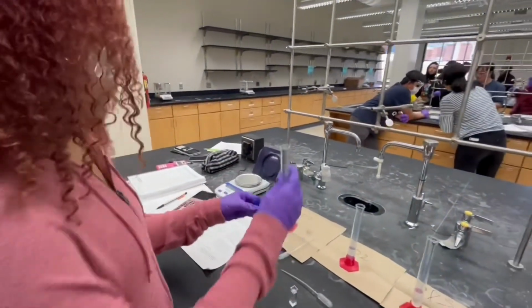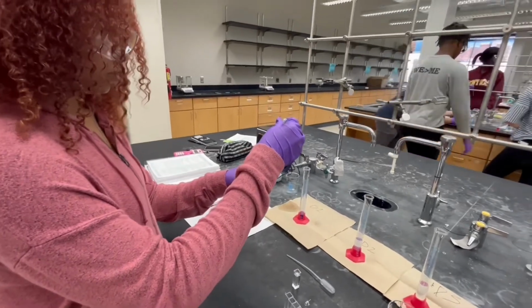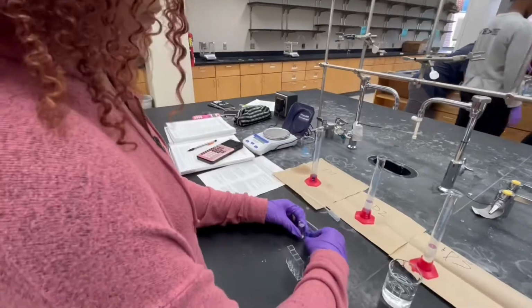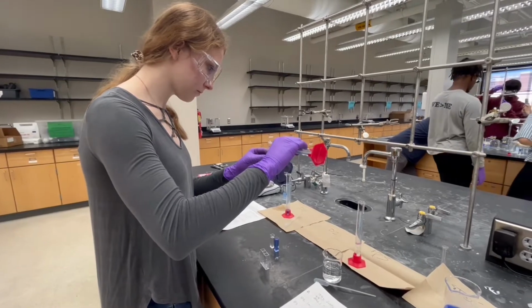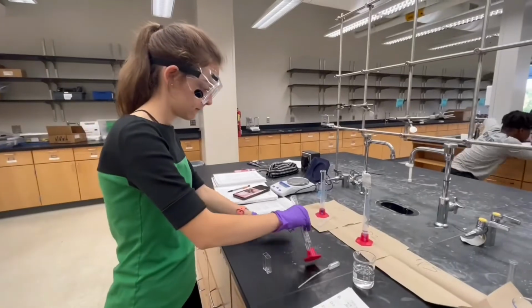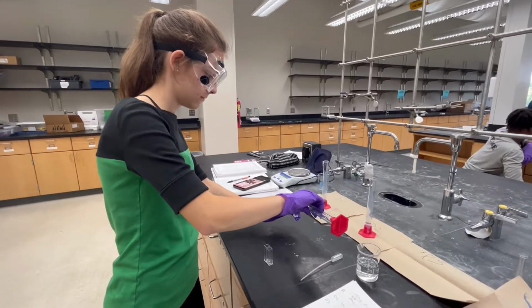Using a pipette, each solution is poured into a cuvette, a container that we will use for the spectrophotometer. One of the cuvettes is filled with water, which is called our blank. Our blank will be used to negate the effects of the water molecules so we can get a clear reading. If we fail to use the blank, we will get an incorrect absorbance value because the water molecules will have absorbed light.